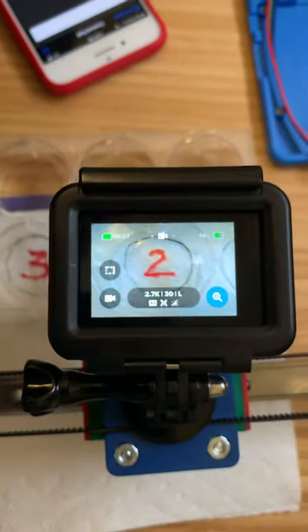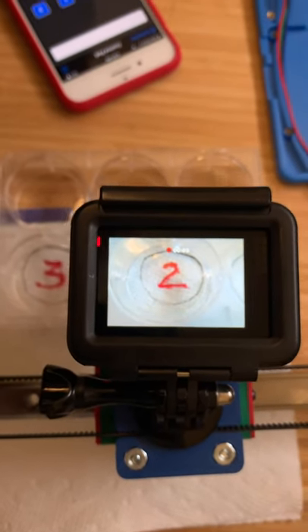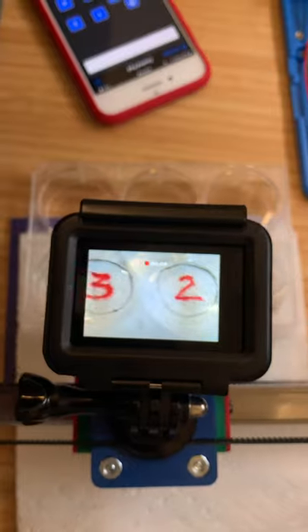Here we can actually see what it's doing. And there's a little delay as it moves to the cell, and then it records here. So you'll notice that I've hit one button on the iPhone and it has moved and will move through the sequence of cells that I've set it up for.